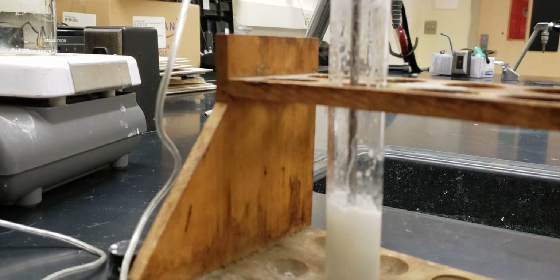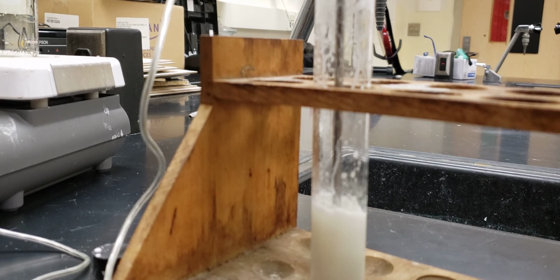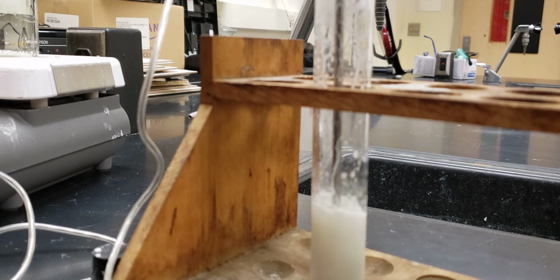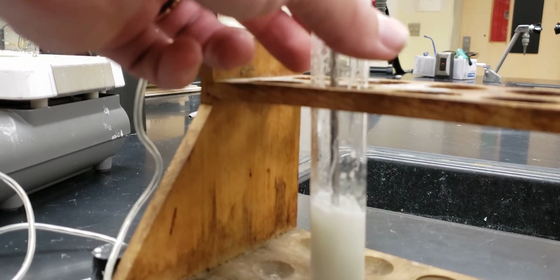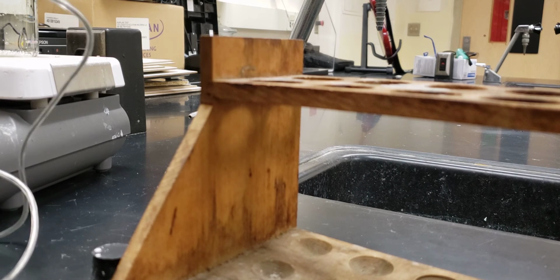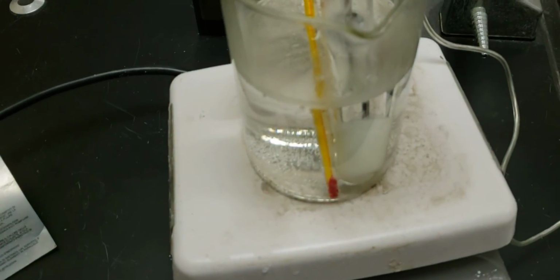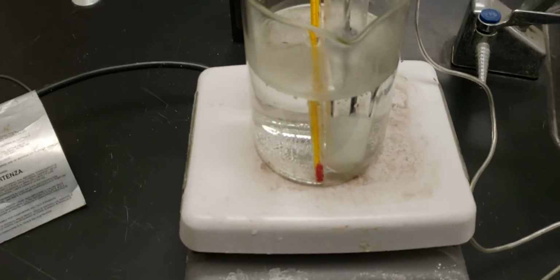And now we're going to pretend as if it has already reached 30 degrees. So at this point, we're going to remove it from this container here, and we're going to start heating it now. And it's going to end up doing the exact same thing but in reverse. And when it does this, it's going to show the heating curve. So in this case, our curve will actually end up going up.